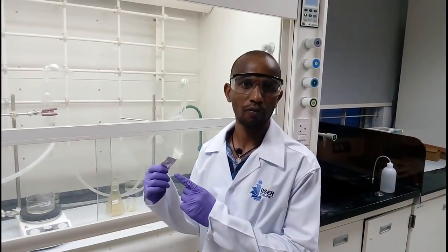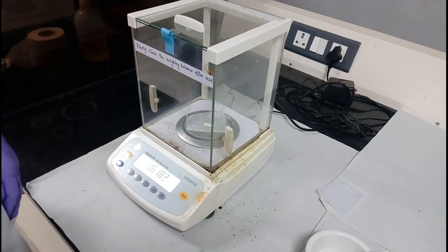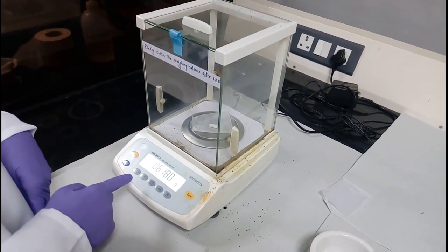Today we are going to determine the acid neutralizing power of a commercial antacid tablet by using the back titration method. Note down the weight of the antacid tablet for future calculation purposes.